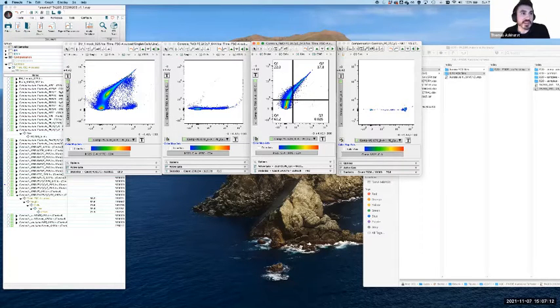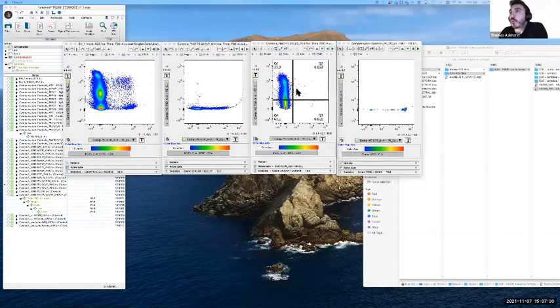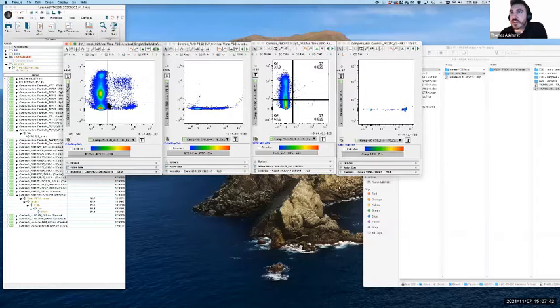So what we can do is increase that value. Let's say we go for maybe 10. And now we've gone too far. We've kind of flipped the problem the other direction. So 10 is clearly too excessive. I think the real value was 4 or something. So if we go for 4, no, maybe I was wrong. Maybe it was a bit less, but that's still a little bit too far. We can probably bring that back a little bit more. That looks pretty good.